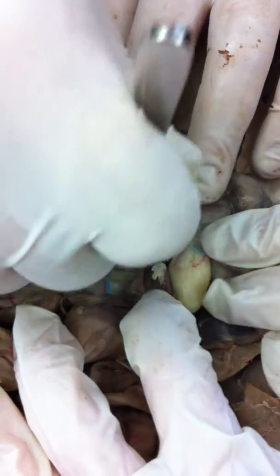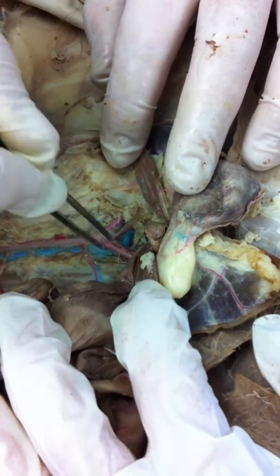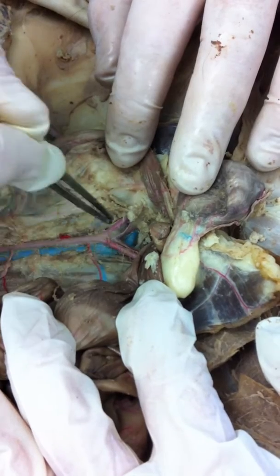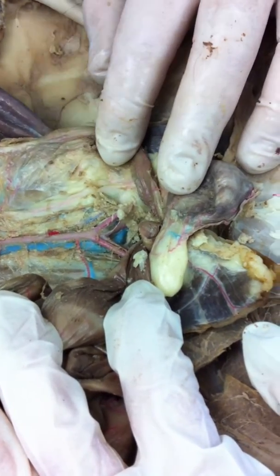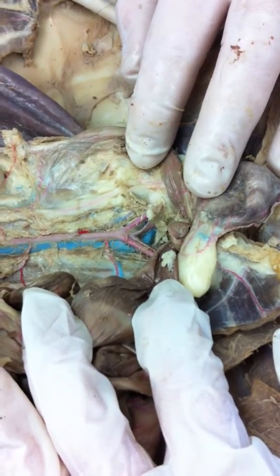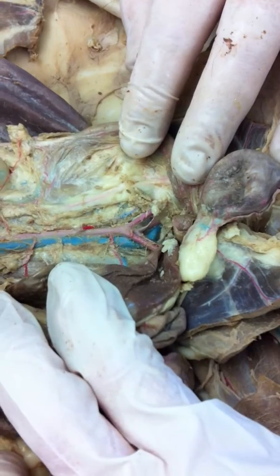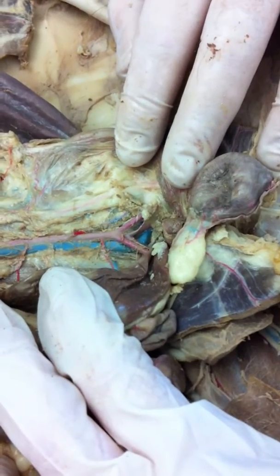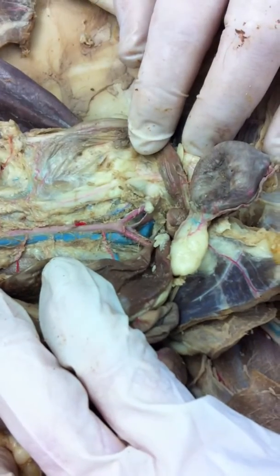The point is it's going straight down at this point, okay? But the aorta gives rise to the right and left external iliac and right and left internal iliac. And it's still abdominal. But in cats, there's no common iliac like there is in humans. Do the external iliacs turn into the femoral? Mm-hmm. And internal iliac is going to come down here and serve the pelvic viscera.